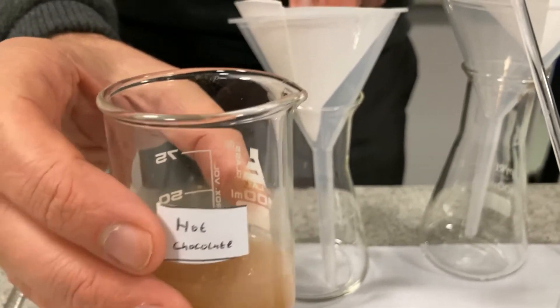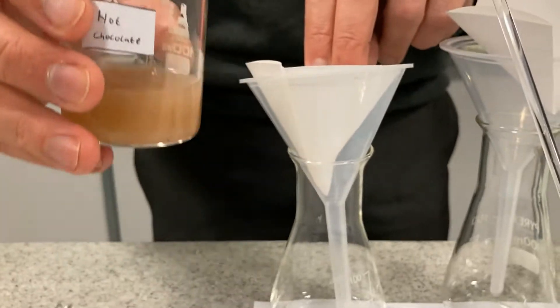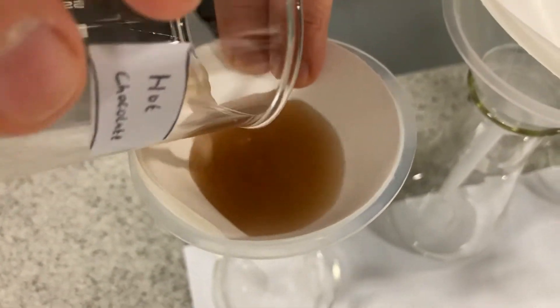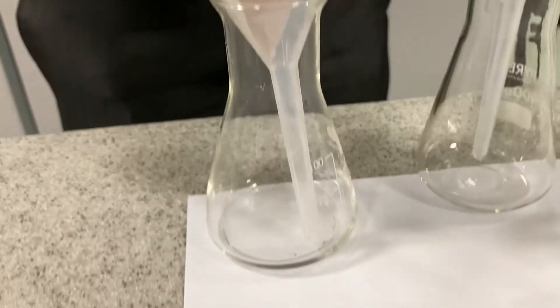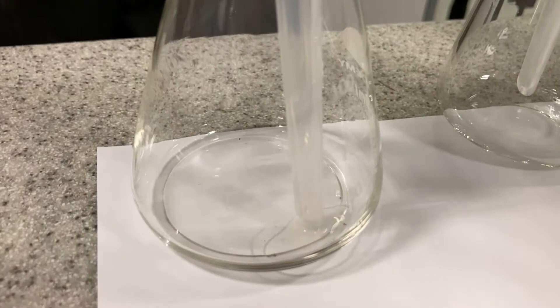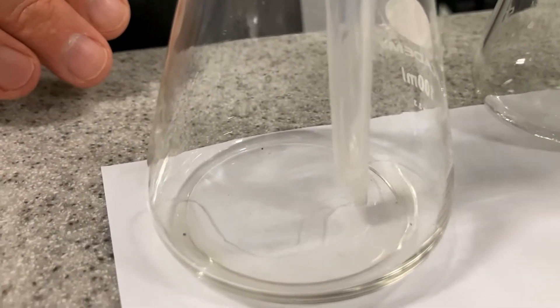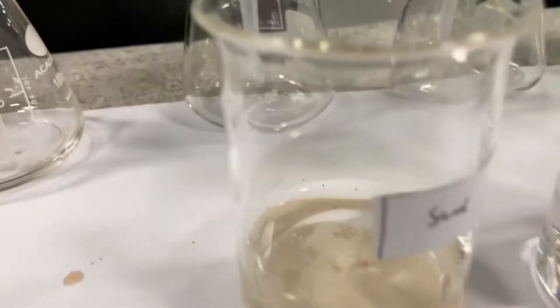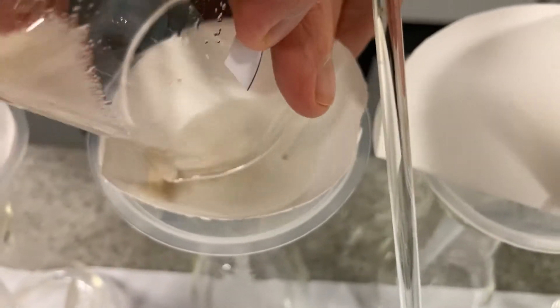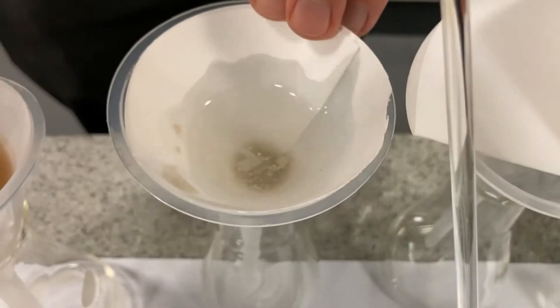I'm going to pour the hot chocolate into the filter paper — remember it was a suspension to start with, not completely dissolved. I'll leave it there and that'll take a couple of minutes. Straight away you can see that's actually clear water coming out the bottom. The next one is sand — let's pour it through. You can see the sand, which didn't dissolve, just sitting in the bottom of the filter paper.